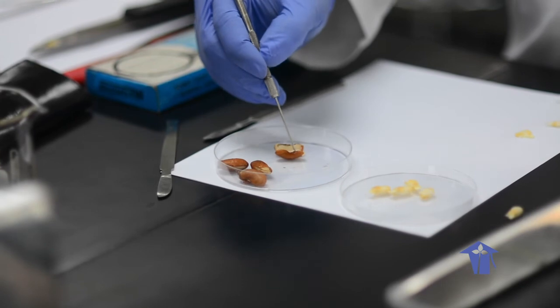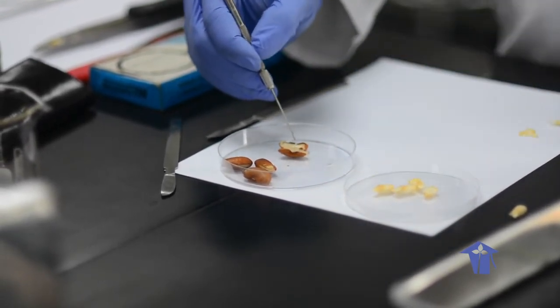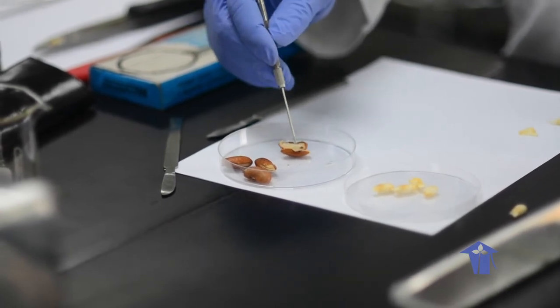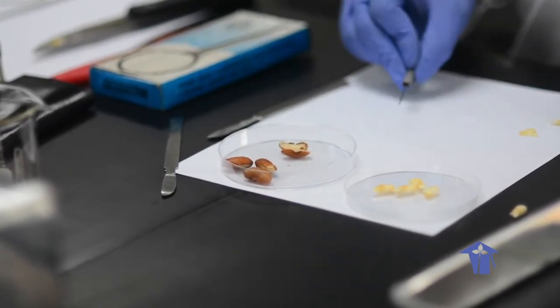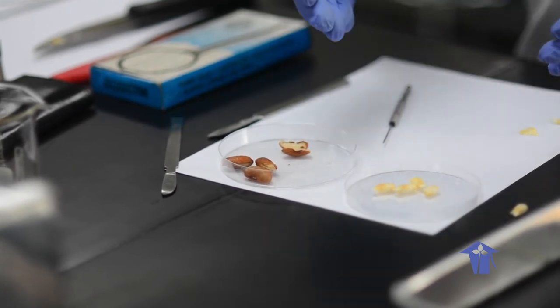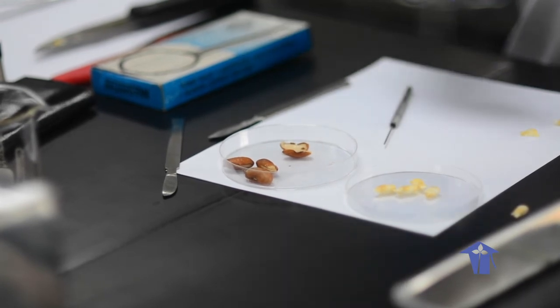And here are two cotyledons on your red bean seed. Your endosperm is in there, and that's where the seed would basically get its food from on the inside, in order for germination to occur, right? And so light controlled cuts with a sharp blade, because the key thing about the dissection, you don't want to destroy the structures because you want to be able to identify them.